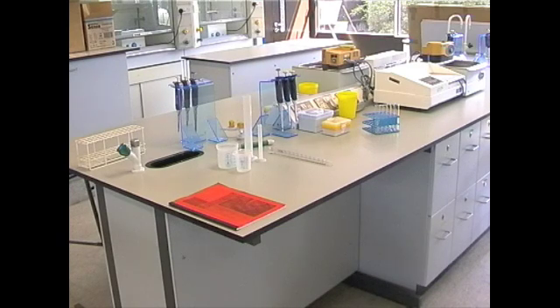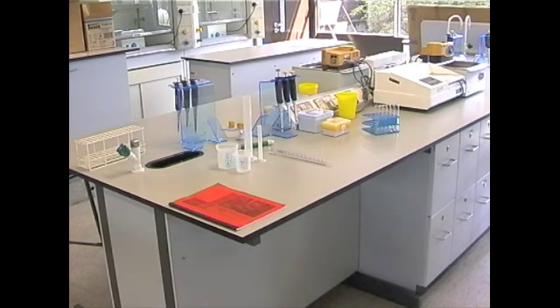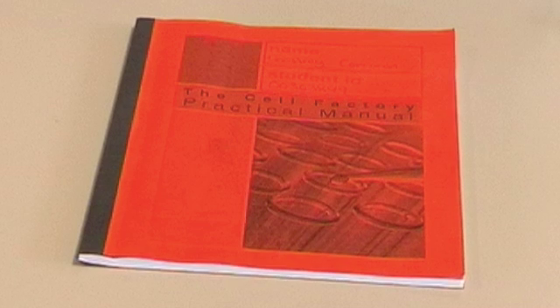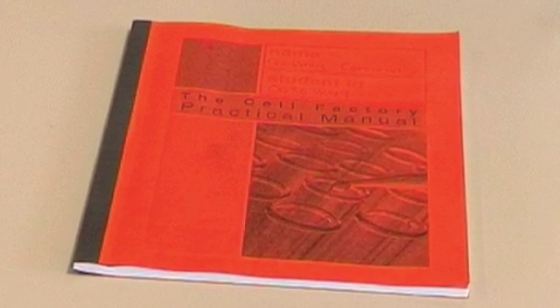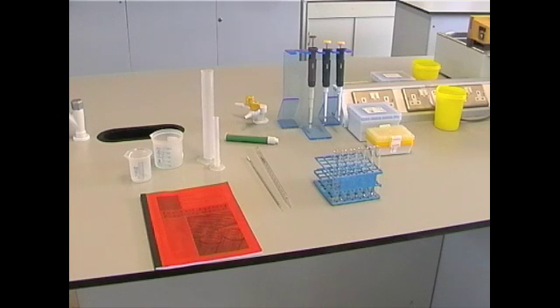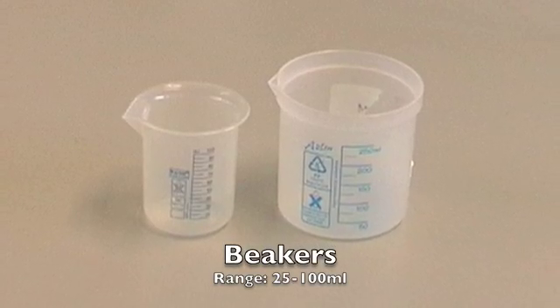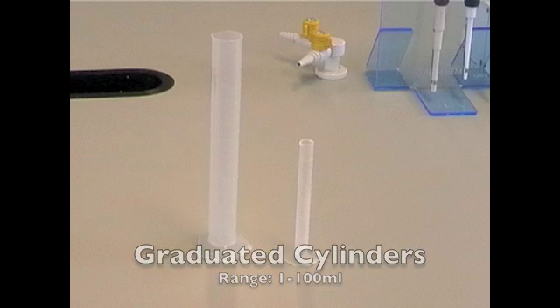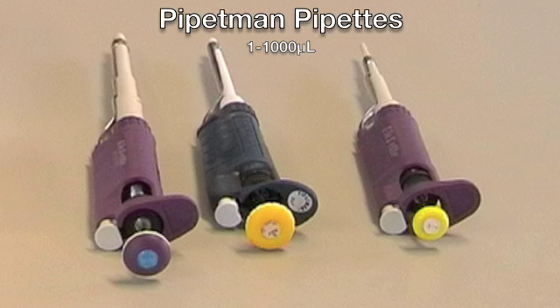When dealing with liquids, it is essential to know the range of devices available and in what situation they should be used. Familiarity with liquid handling devices is essential for any experiment involving liquids. The lab manual is the most important piece of equipment that should never be forgotten. Here you can see the range of liquid handling devices available: beakers, graduated cylinders, serological pipettes, and pipetman pipettes.